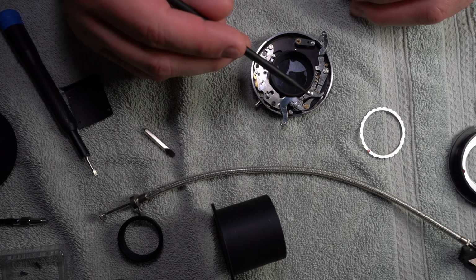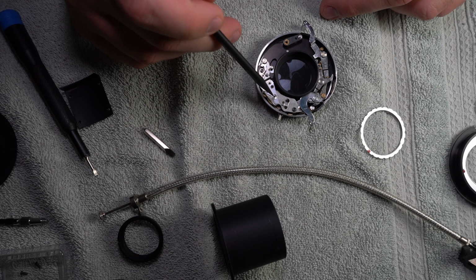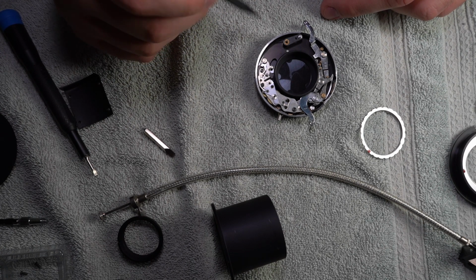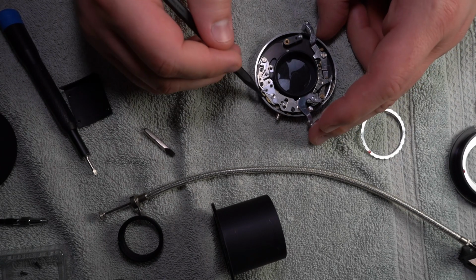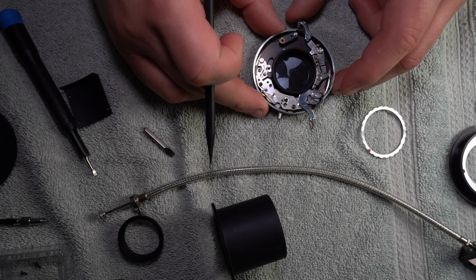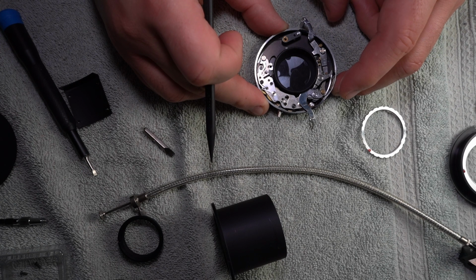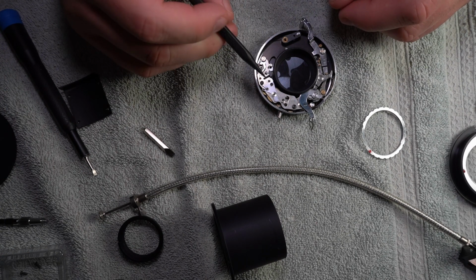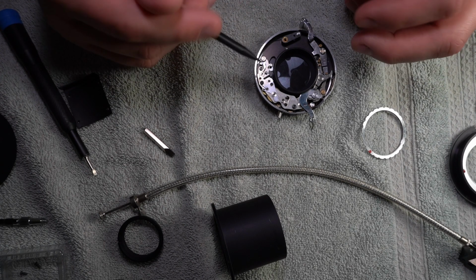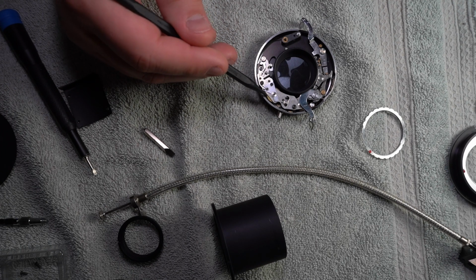And then the other thing he was saying was about these gears in here, which spin pretty fast. You can watch them, these in here specifically, they just moved, and they all move pretty quick. He was saying you've got different types of gears and things in watch movements, and these move really fast.